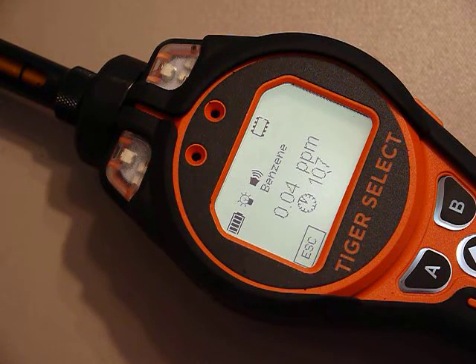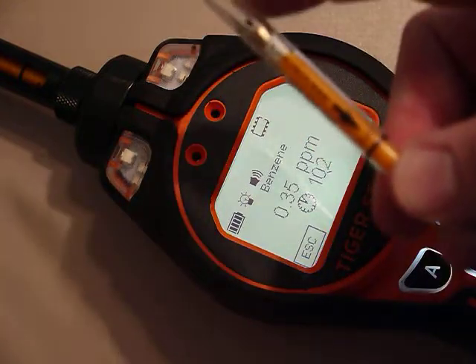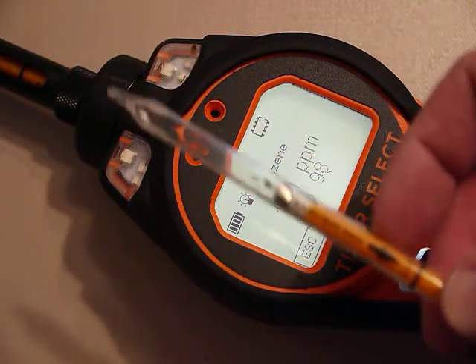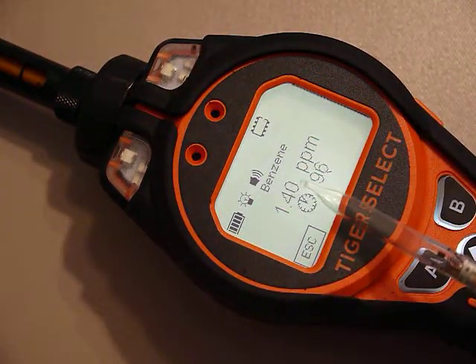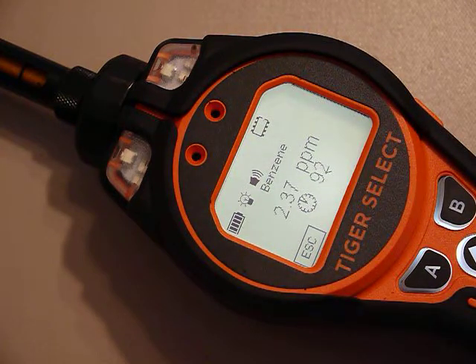That tube — and here's another tube just to show you — allows the gas to come in, absorbs all the other VOCs, and only lets benzene come through. You're just starting to see readings now because some of the time is just getting the gas through the tube and filtering out the other VOCs.